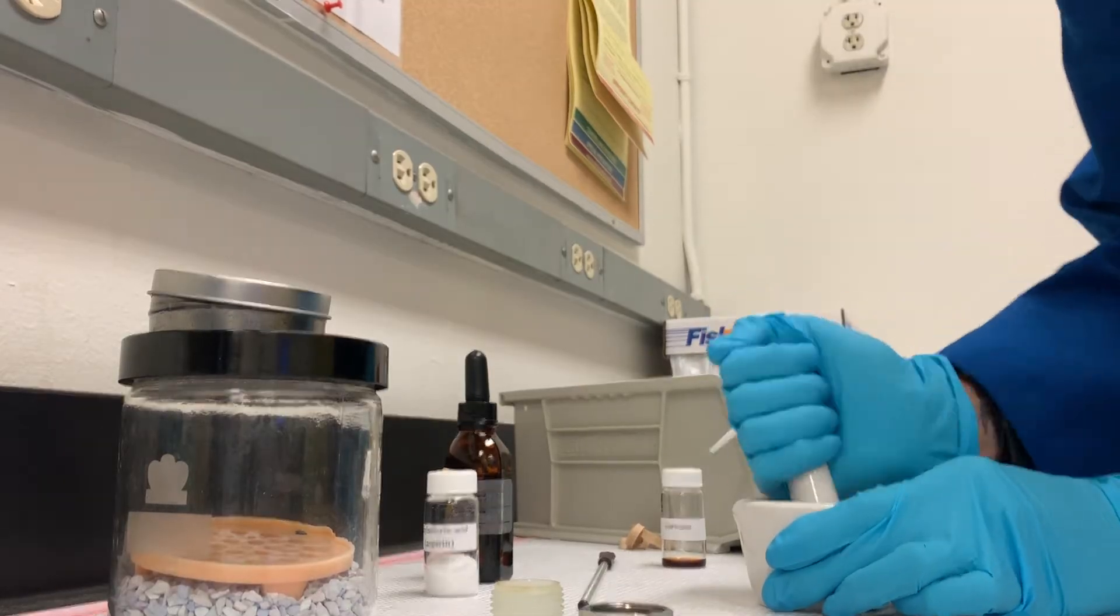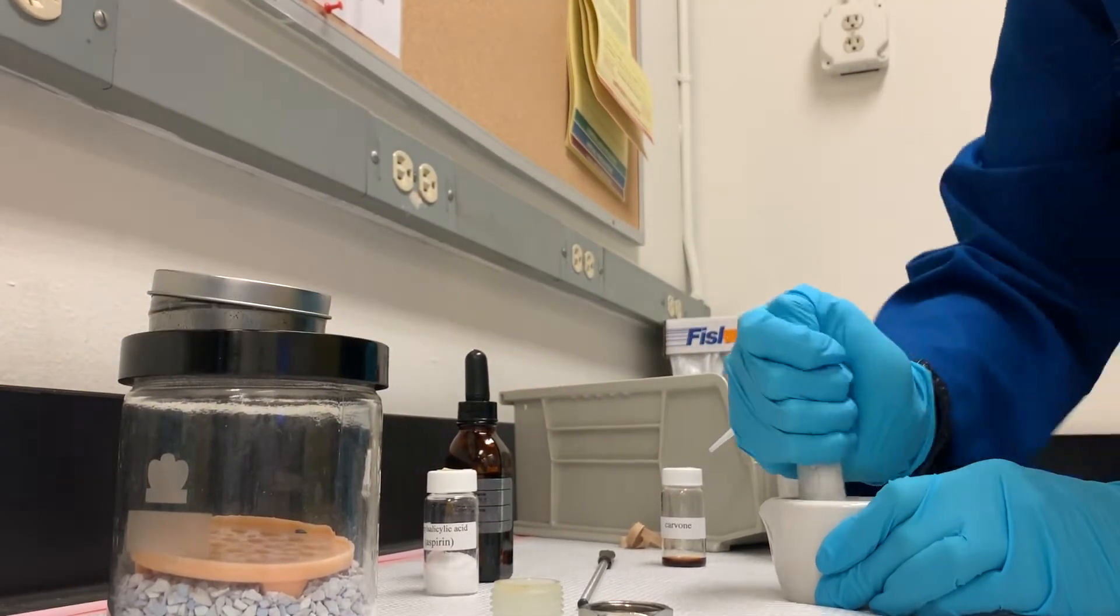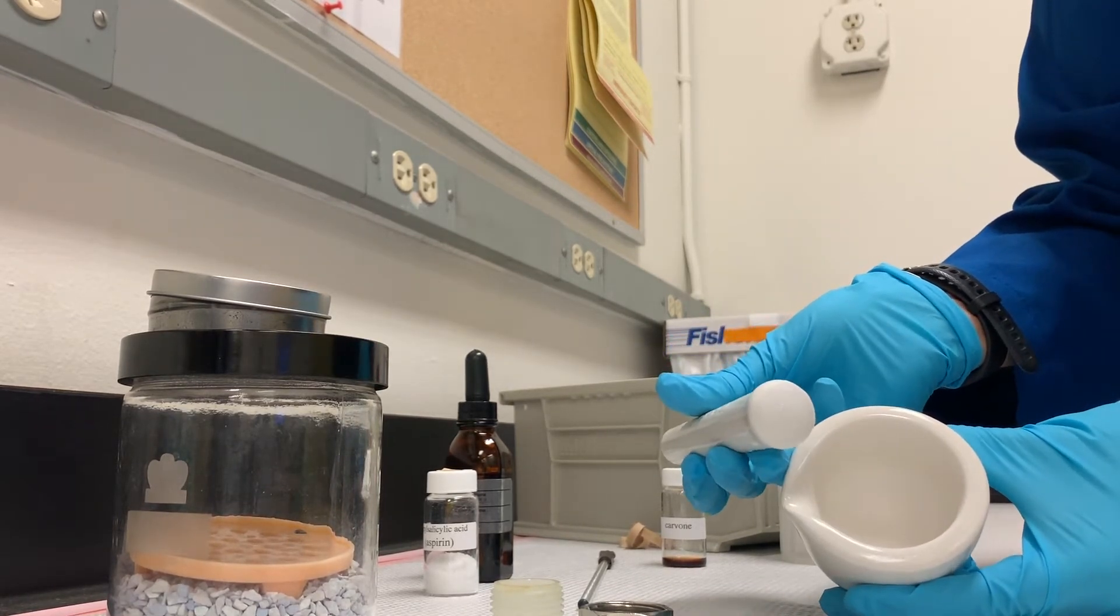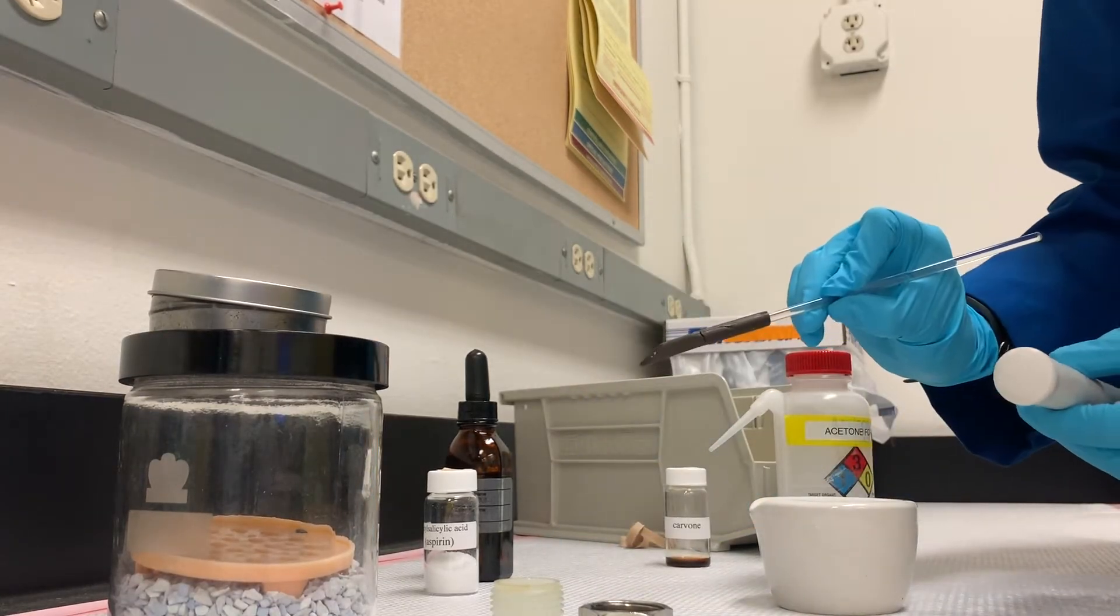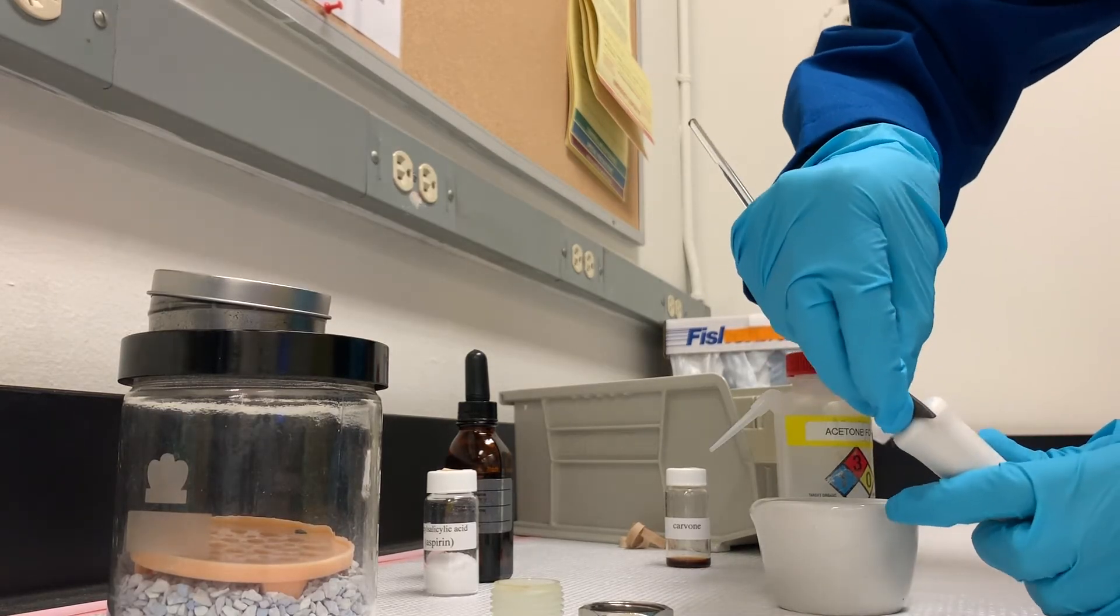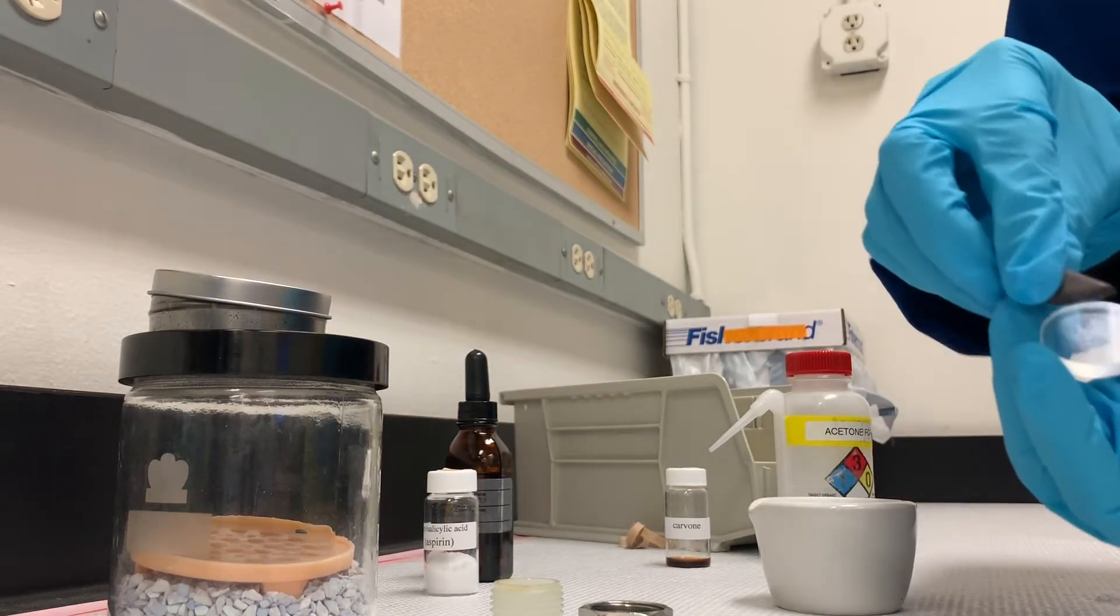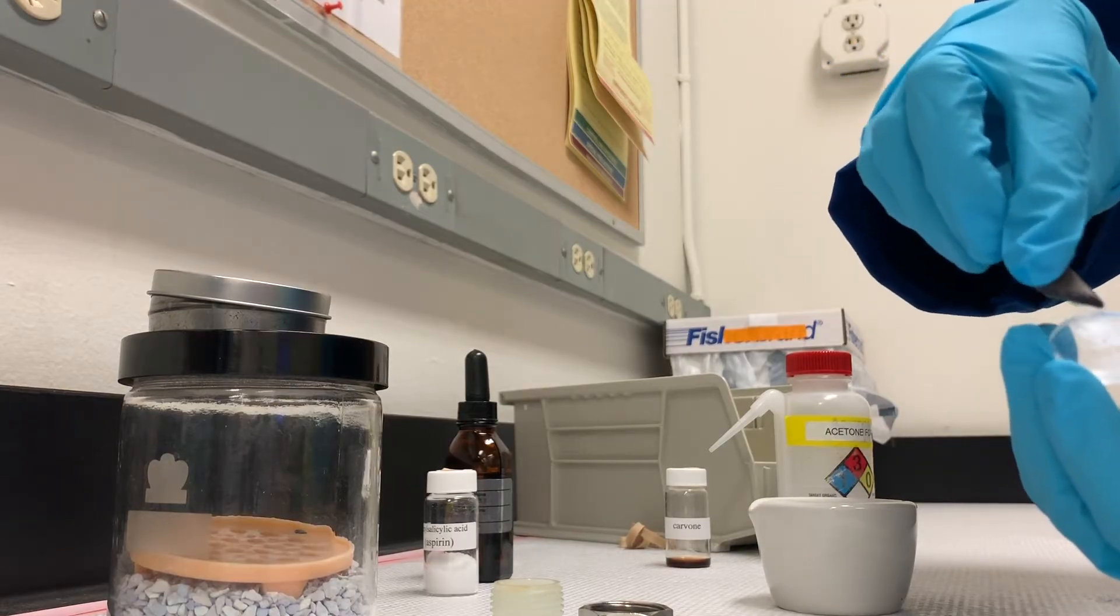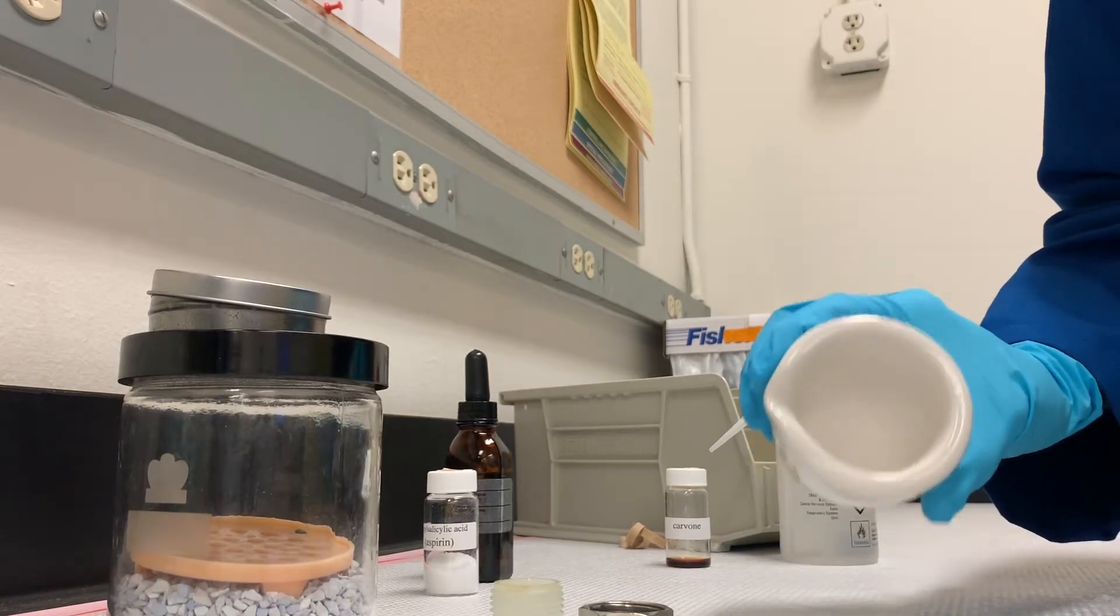And then I grind this to a paste. I count to 60 as I'm doing this. What I'm left with looks like nothing, but there is stuff on there. So we're looking for a very thin toothpaste. A lot of times it's enough to take your cool little rubber policeman, scoop off this stuff so you can actually see there is some stuff on there. Now I do a little wipe. That's actually enough sample. We don't want too much sample on there because then we get scattering. So a lot of times we don't even need to use what's in here.